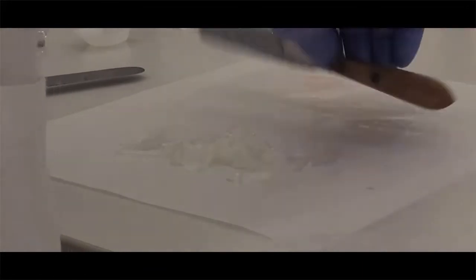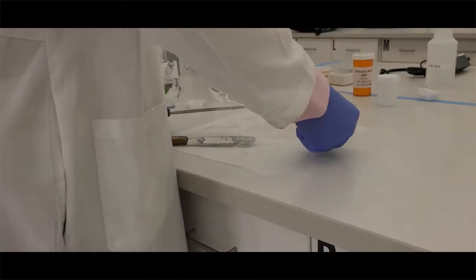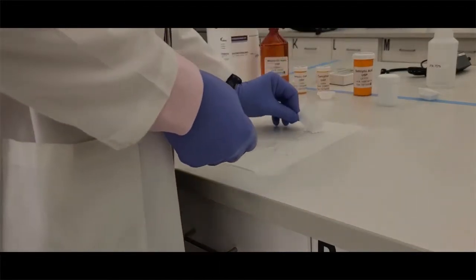The amount of white petrolatum that I weighed is the total amount of white petrolatum that I calculated in my formula. So I have the total amount of ointment on that center pile and then I'm just using one third of it.